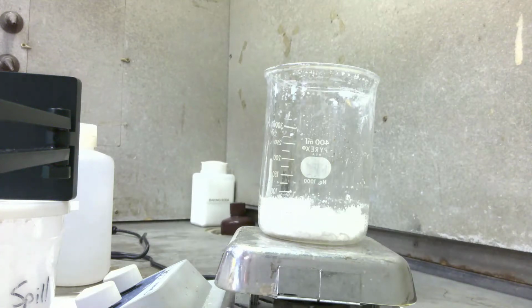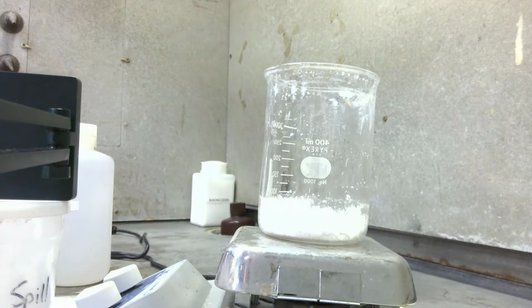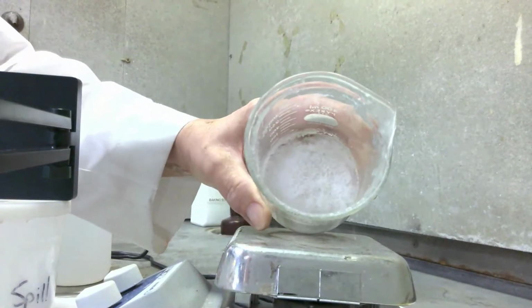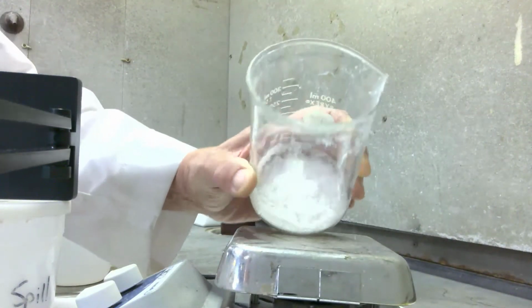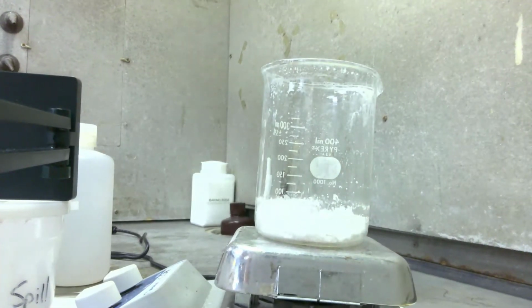This is part 2, or week 2, of the aluminum lab. If you notice, you're seeing the white crystals of the potassium aluminum sulfate dodecahydrate. Because we left it too long, all the water evaporated off, so all we have is the white crystals. If you were to look into the beaker, you would see them. Very nice crystals. Now what we need to do is take those crystals, rinse them off with a little bit of alcohol, run them through a filter, and then dry them a bit and weigh them.